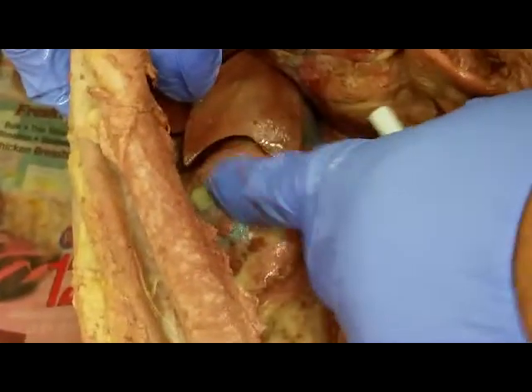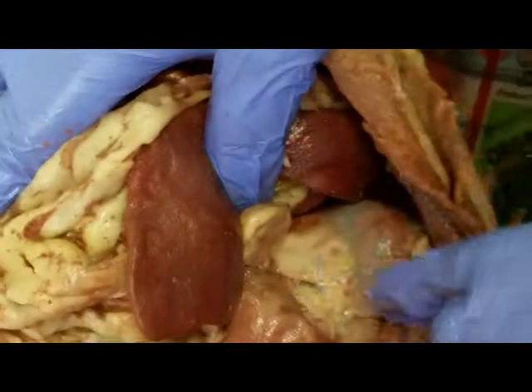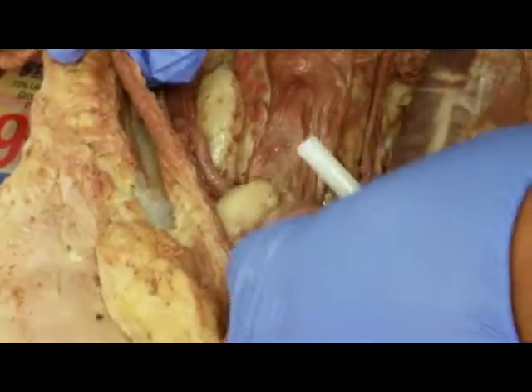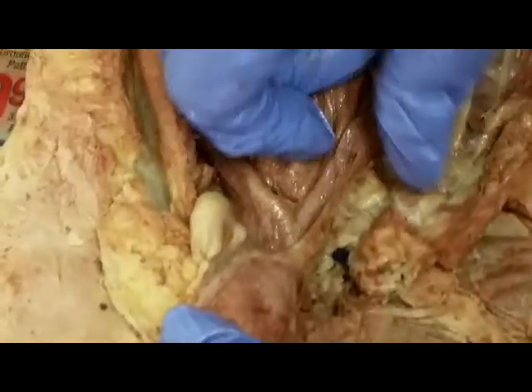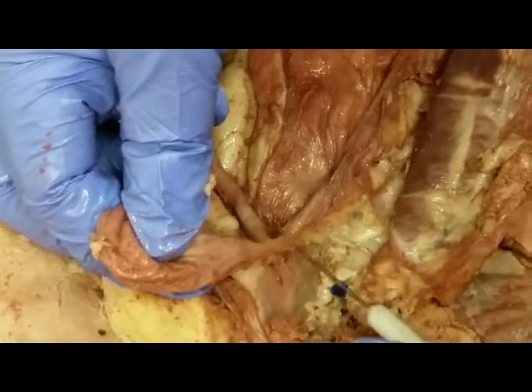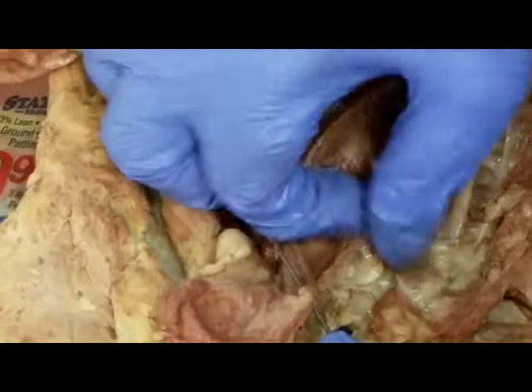These are the kidneys. So here's one kidney, and here is the other kidney. This one is a female. Watch carefully now. This is a urinary bladder. That's the urinary bladder right there. And what is this running from the kidney into the urinary bladder? This tube. That's the ureter. So that is the ureter.